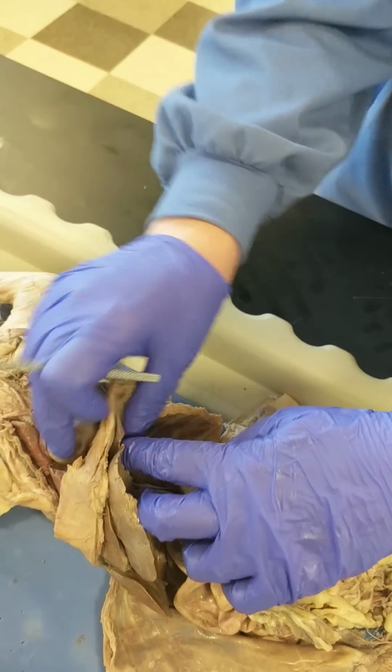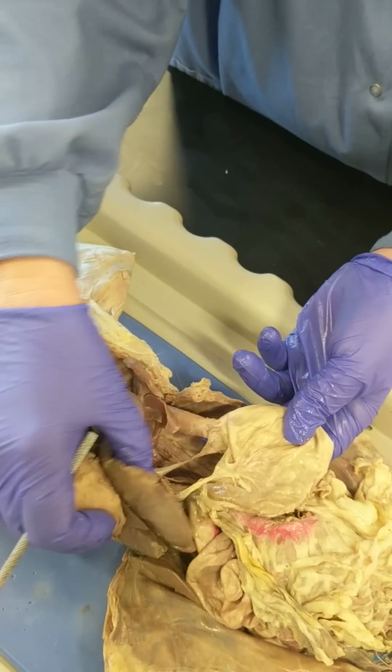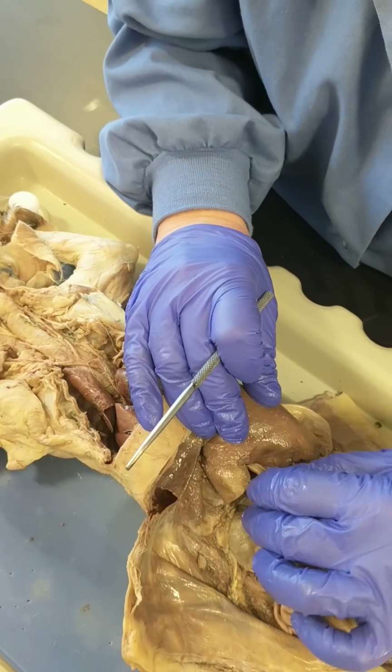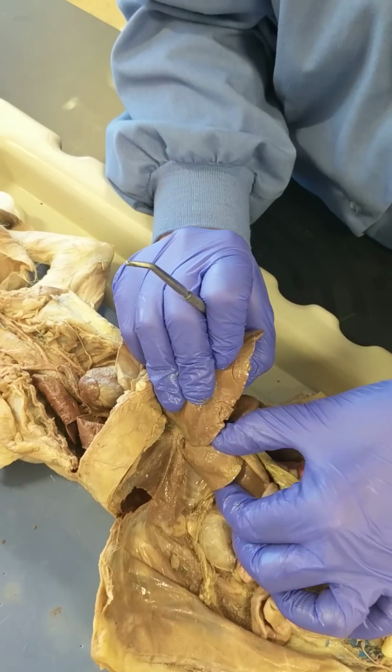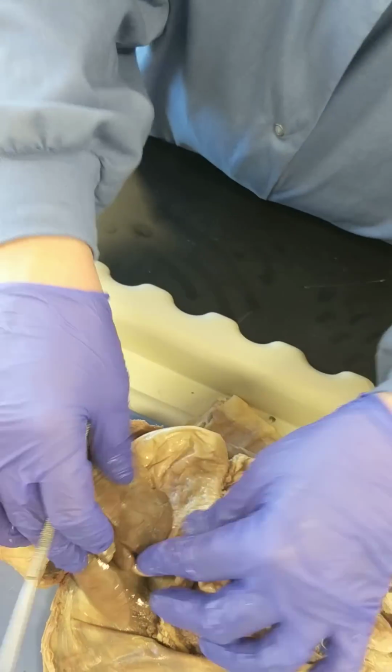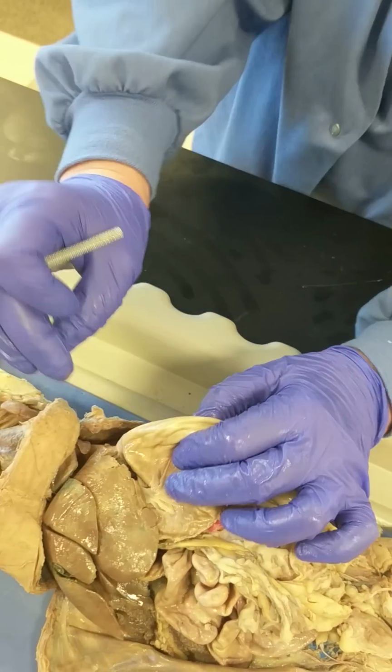Okay, so the esophagus comes down. And the right medial is where again? Oh, the right medial? Did I miss that? No, I just want to make sure I got it. Right, this little guy. Okay, right medial. This one right there. Yep. Thank you. And then back to the stomach.